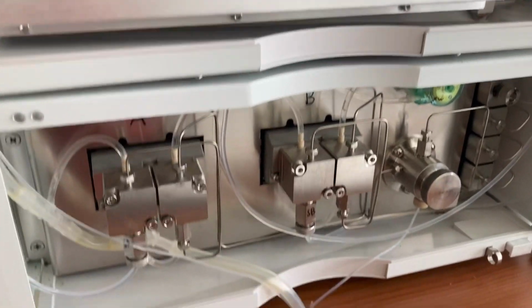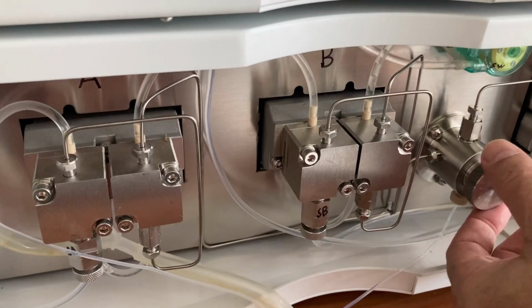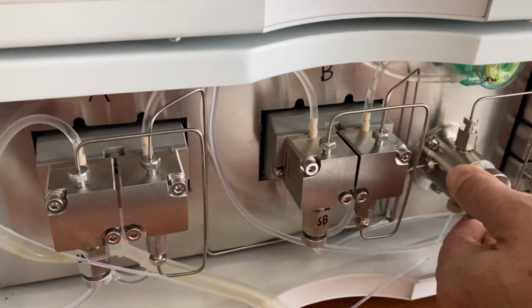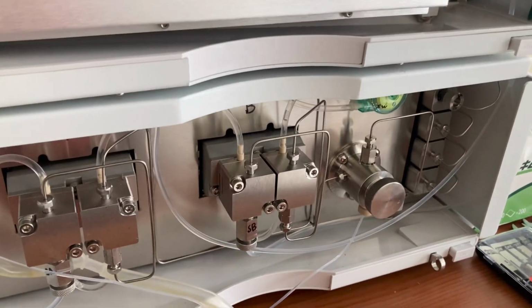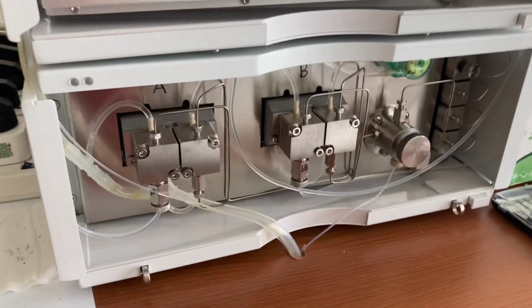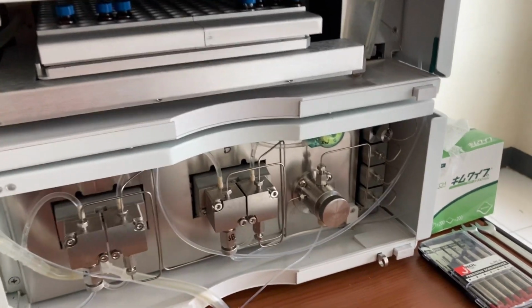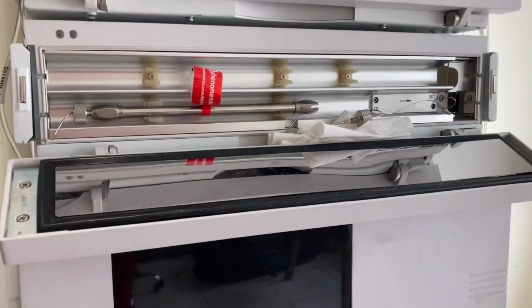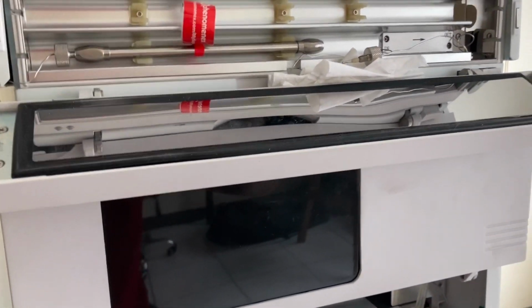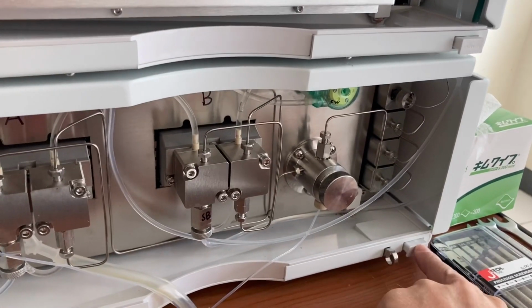The binary gradient pump here, we've got to turn or open up, is probably the better way to say it, the valve, so we can bleed the system of air. Do that first before turning it on, and then we turn the system on, all the 5 switches there, turn them on before turning on the software on the computer. That's just the way we do it. So just go and turn them all on.